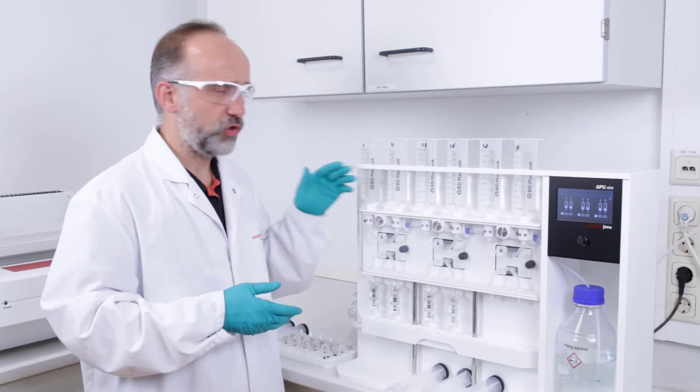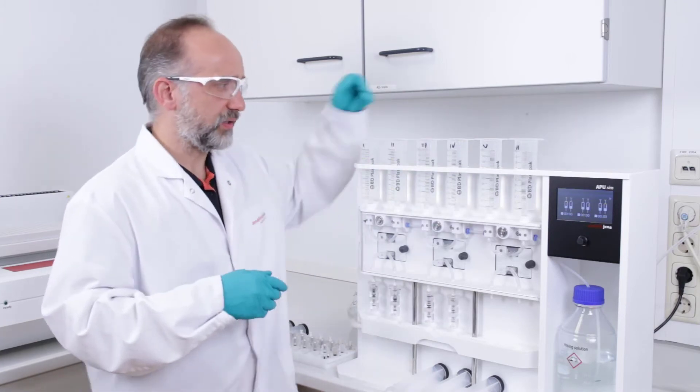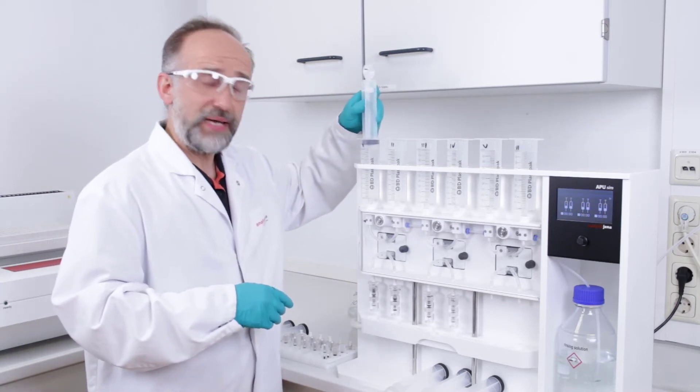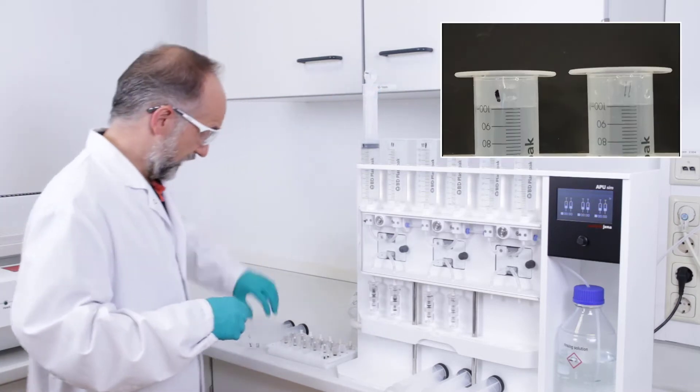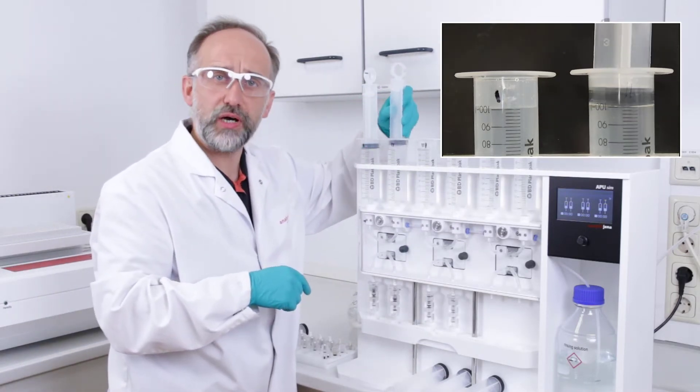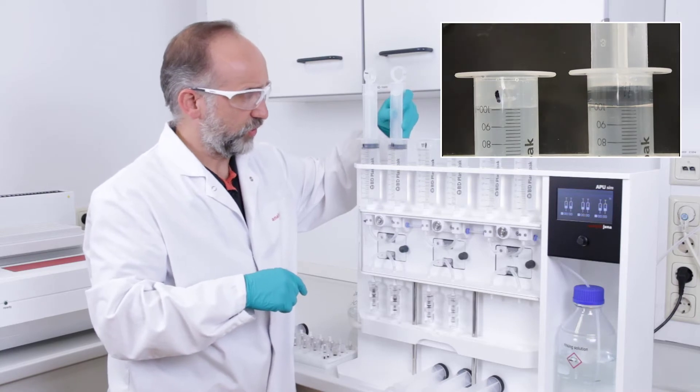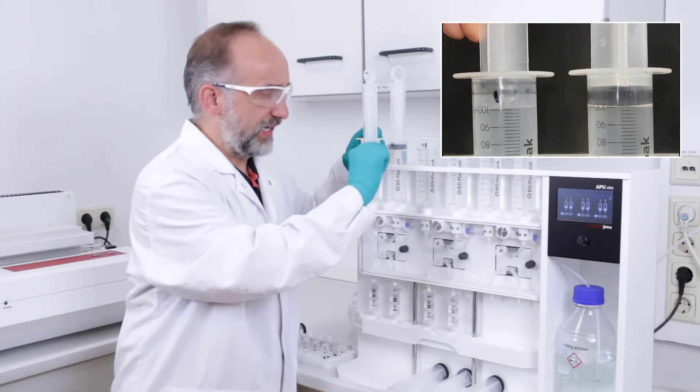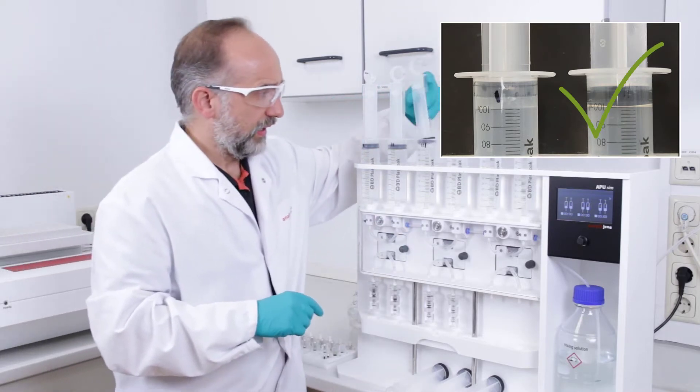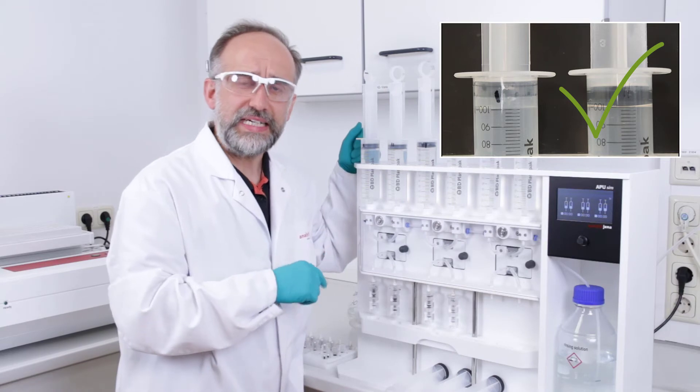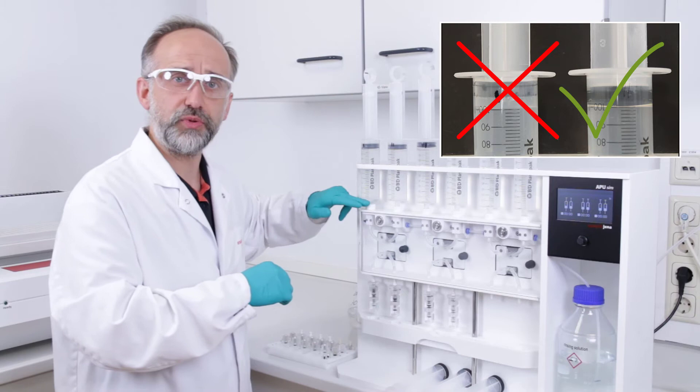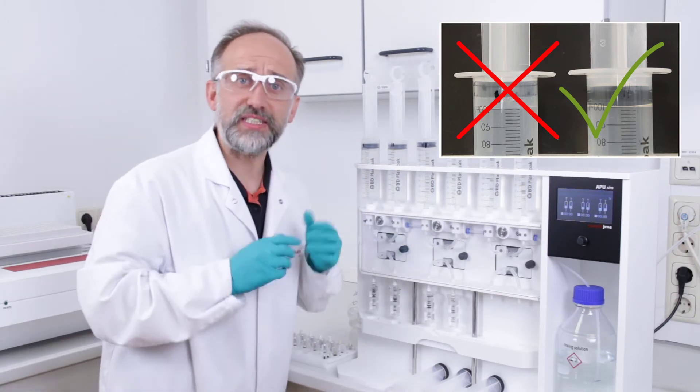If this is done completely, then we have to add the pistons onto the syringes. It's really mandatory to add the pistons to the syringe body in a circular way because we have to release the air gap which might be present there. The air gap which might be present is not very useful because in the end of the adsorption, that means if the piston is to the end position and the air gap is still present, we have a big problem.